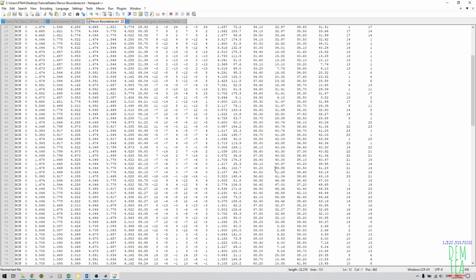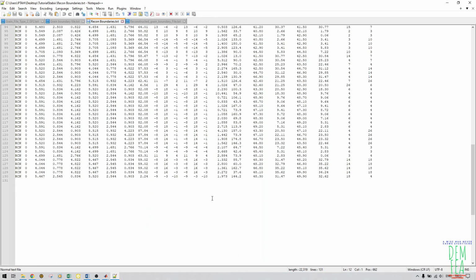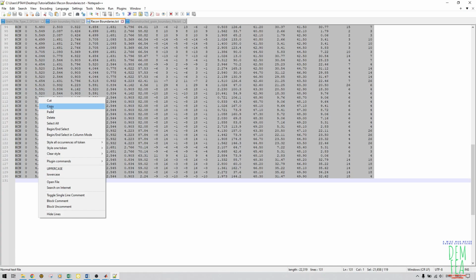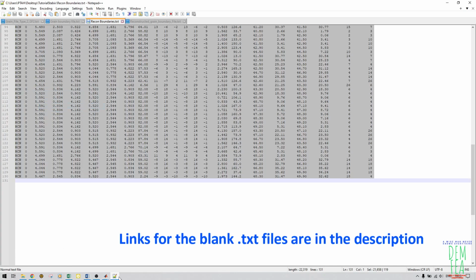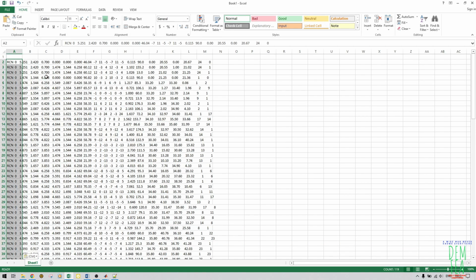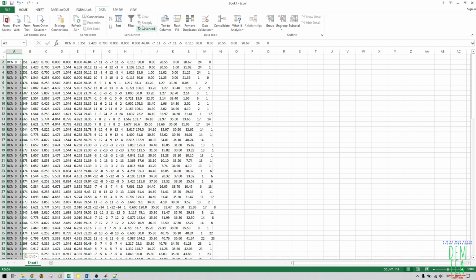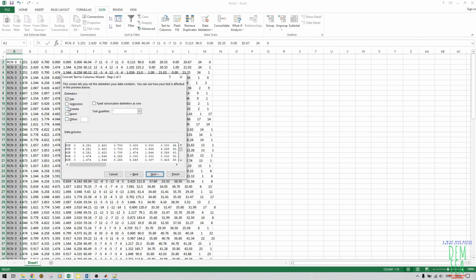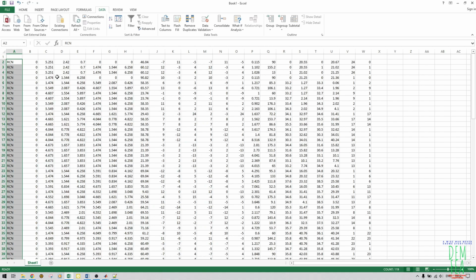begin select, and then you come here and select, copy, and then once you copy this, just come to your Excel and you paste like that. And then we need now to convert this to columns. So we go to data, and then text to columns, and then delimited by space. As you can see, we have converted them to columns like that.